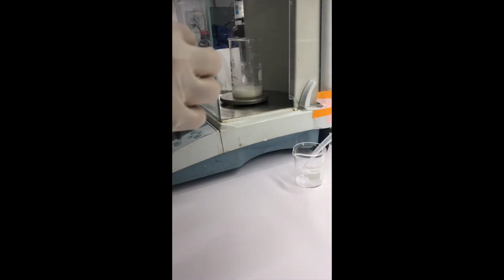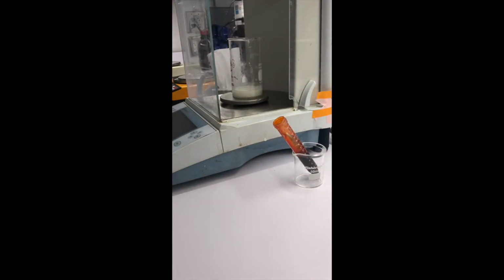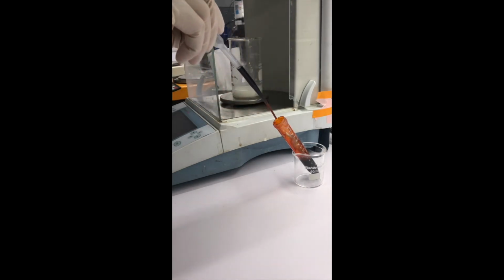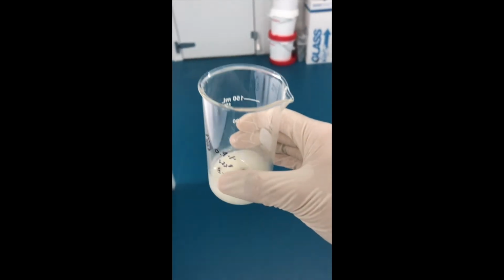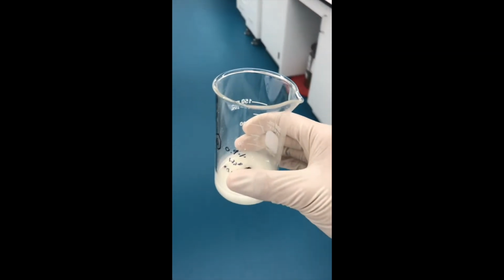So here I'm adding my water. There's my little solution. So I'm just going to open it and be extra careful because this solution can stain, and that's the last thing you want to do, stain all the labware with something that could potentially not come off. And so I'm going to slowly add enough water, and I think here I added 0.9% water, compared to the overall sample. And then once the water is added, I can essentially go back to that same stir plate and then put the sample to mix one more time.